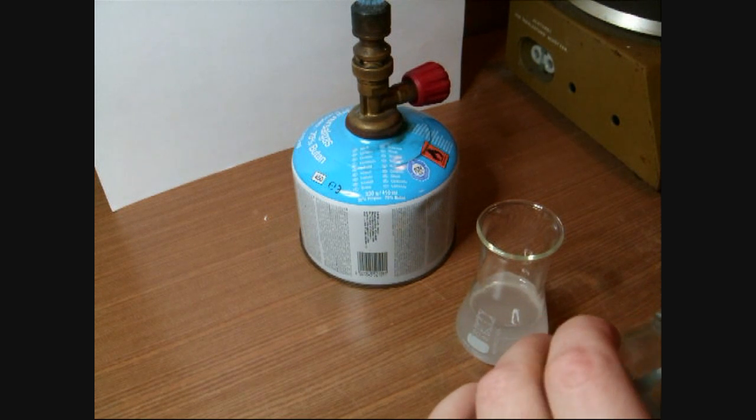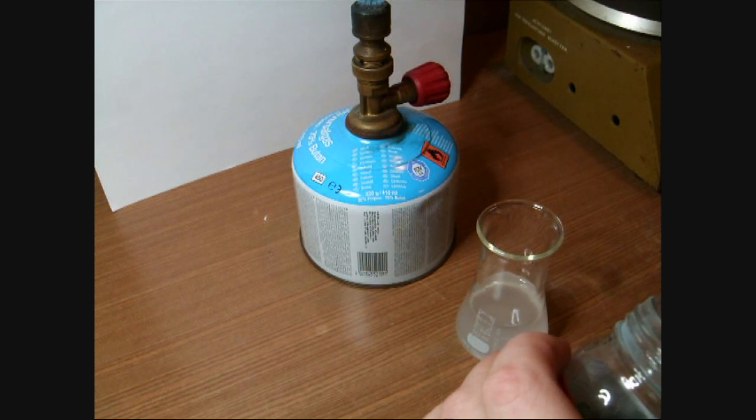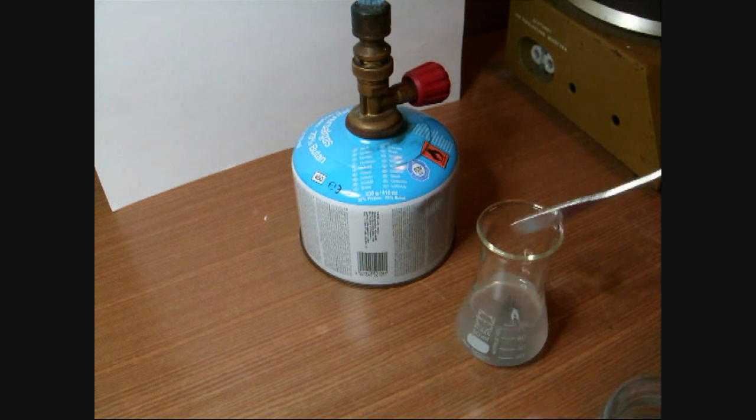At first, some tin salt is dissolved in hydrochloric acid and a few spatulas of zinc powder are added to the mixture.